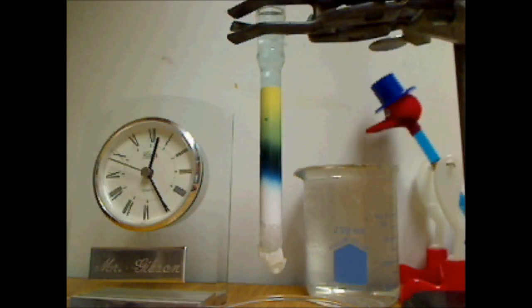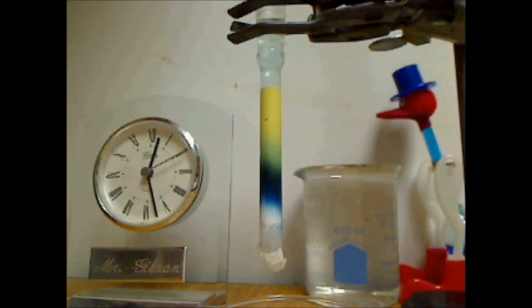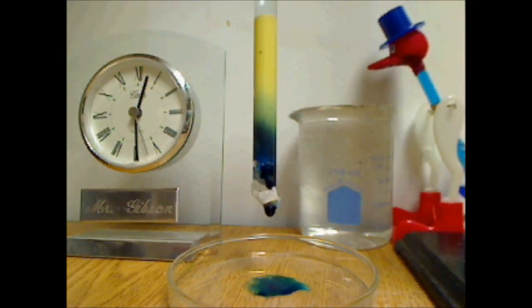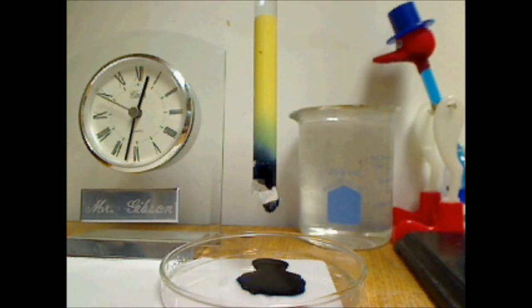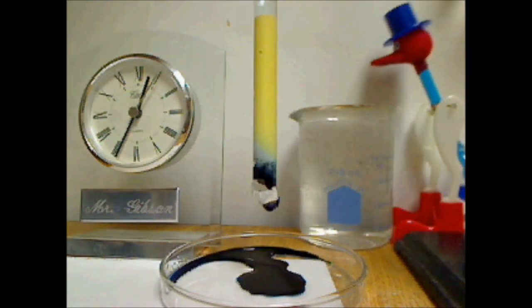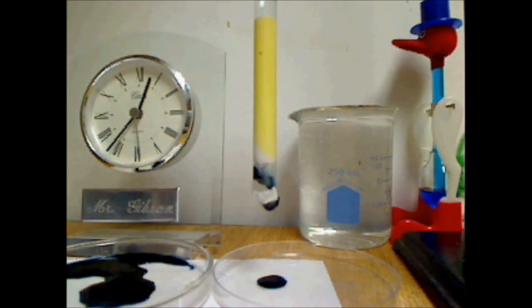So it's been split into blue and yellow, and the green is kind of a mixture between those two. I'm collecting the blue sample first, and then just as I think it's going to be contaminated with a bit of yellow, I've swapped it.